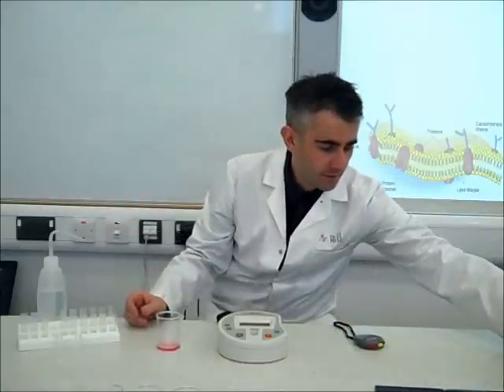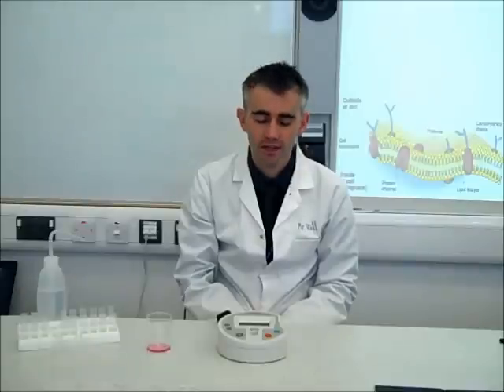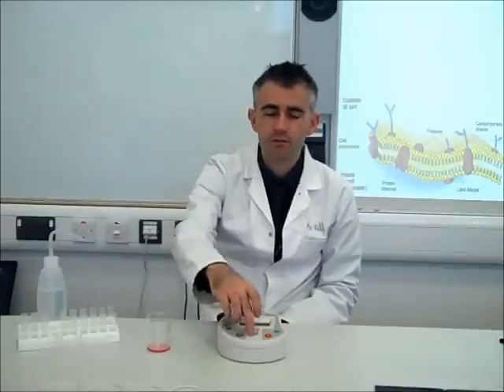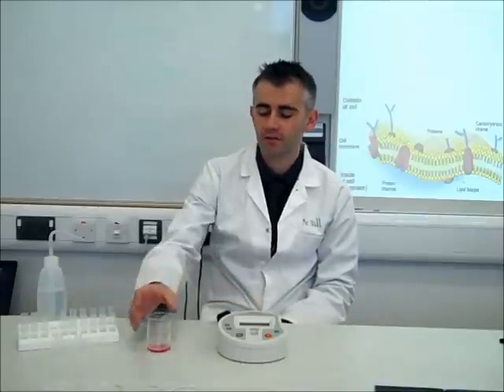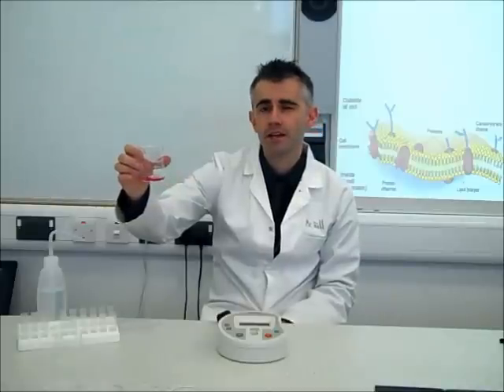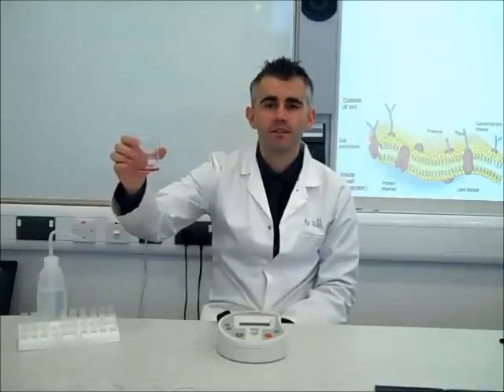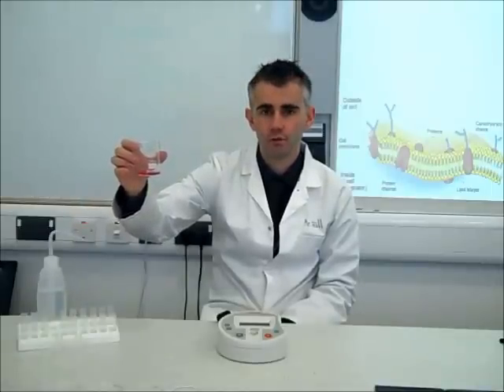We're going to use a colorimeter to investigate the amount of pigment that has come out through the cell membrane and into the distilled water. This machine works by emitting a light source through the solution to a sensor on the other side, and it can work in either transmission or absorption mode. It can detect the amount of light that passes through — the transmitted light — or the amount that does not get through, which is the absorbed light. We're going to use absorbed light as a measure of the amount of pigment. The more permeable the cell membrane, the more pigment we'd expect to diffuse into the distilled water, increasing the absorption figure.